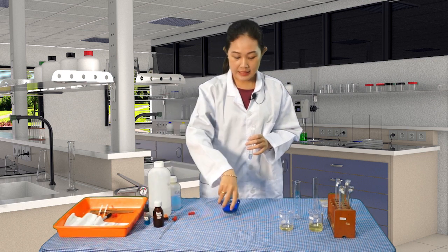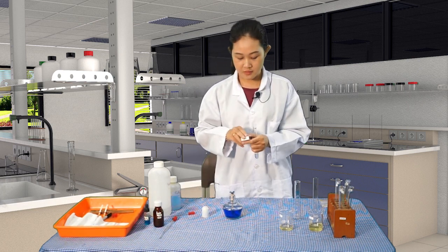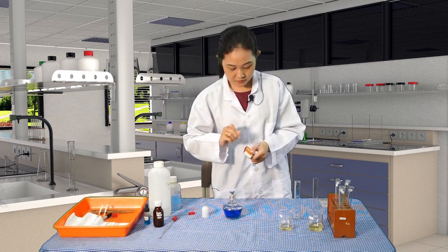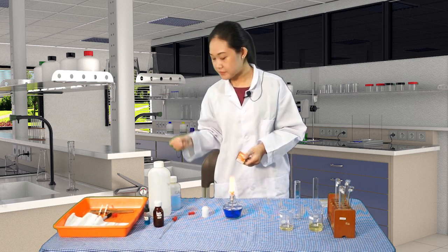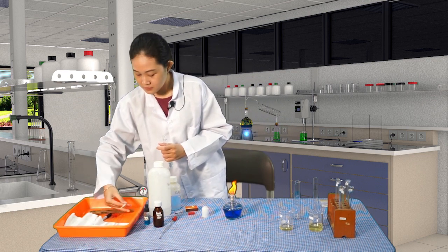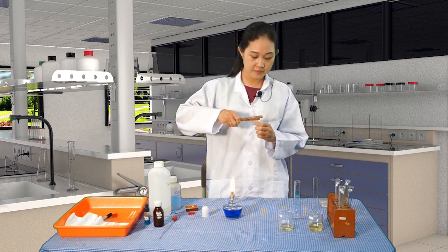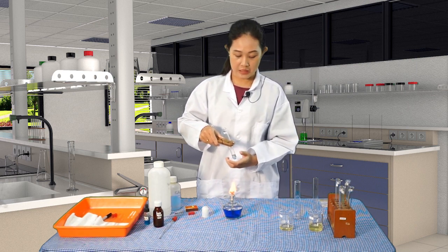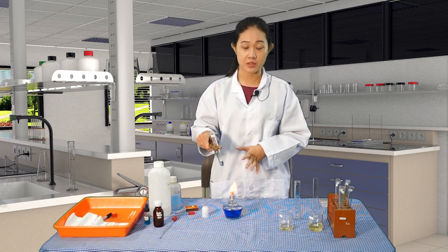At the beginning, the color is bluish, just like the color of the reagent. Now, let's heat it to see the color changes for the sample X. So, use the test tube clamp, and then we can directly heat this, but make sure that it is not exposed to the fire for too long, and make sure you keep a few centimeters distance.